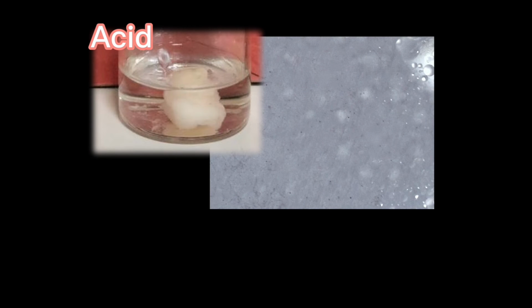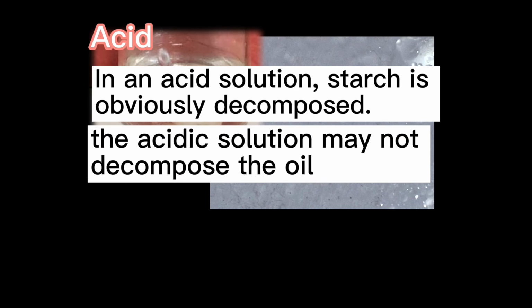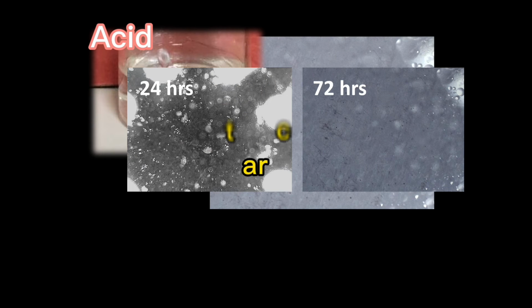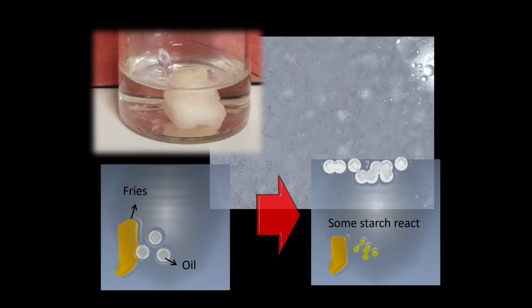In an acid solution, starch is obviously decomposed by the acid, so no starch powders can be seen in the solution. Compared with the 24-hour time-lapse image, many starches had not been completely decomposed, and these powders almost disappeared in the 72 hours video. A large amount of oil indicates that the acidic solution may not decompose the oil. The oil is observed in the water because there is no starch to support it.